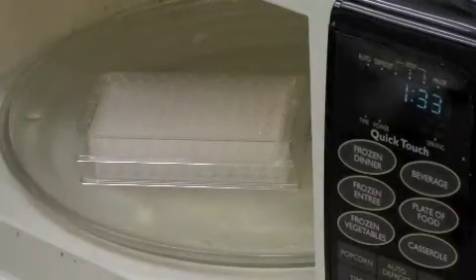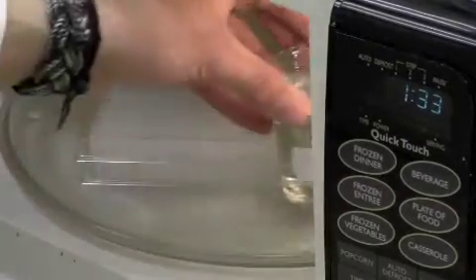Microwave the plate with the second plate as a lid for 20 seconds, along with 100 milliliters of water as a heat sink.